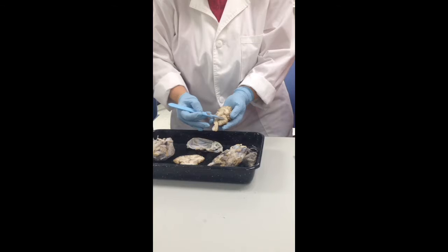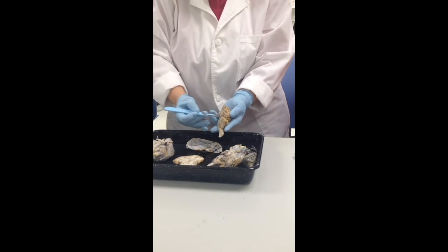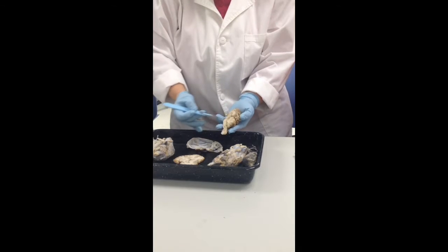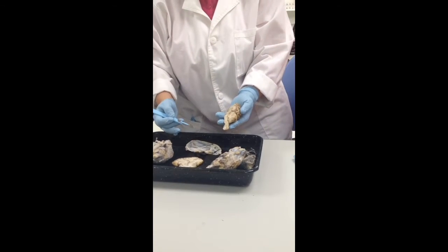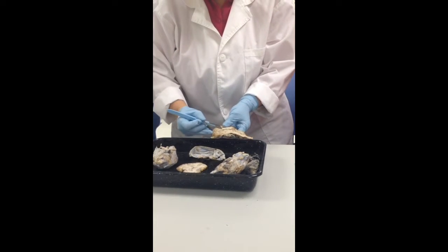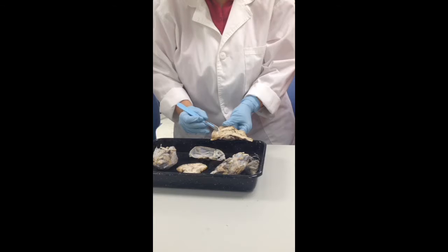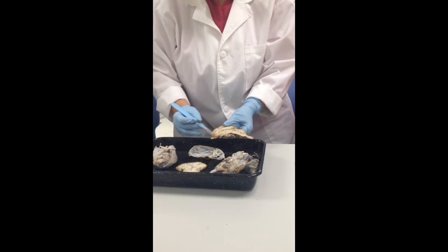Do you guys remember what this white matter is called? Arbor vitae. And the little tiny gyri of the gray matter? Folia. They're the leaves of the arbor vitae. Okay. So, another thing that you have here that's white matter, your commissural fibers, is this big structure here. That is the corpus callosum.